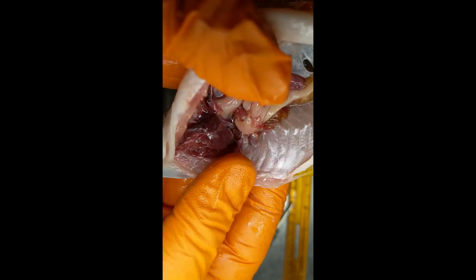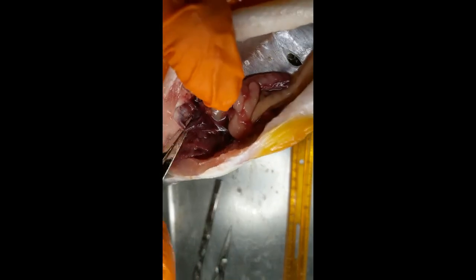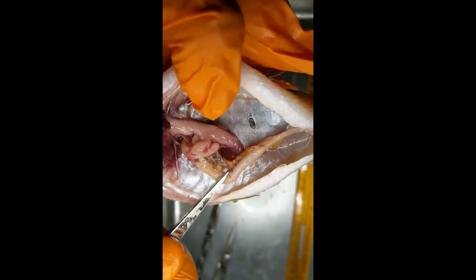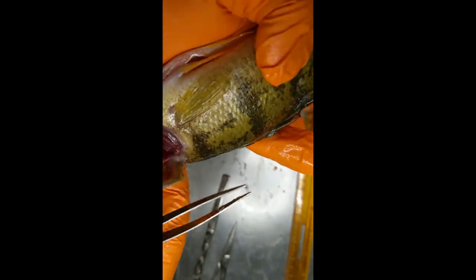Here's what we've got left. You can see the heart right there, and you can see the back of the gills — those deep red plates — which is what they use to breathe underwater. The heart is what they use to transport blood. Another good thing is to take a quick look at all the organs to see if there are any parasites or scarring, and take a look at the gills too, since some parasites will actually feed on the gills because they're really nutrient rich. Overall, this fish looks pretty healthy.